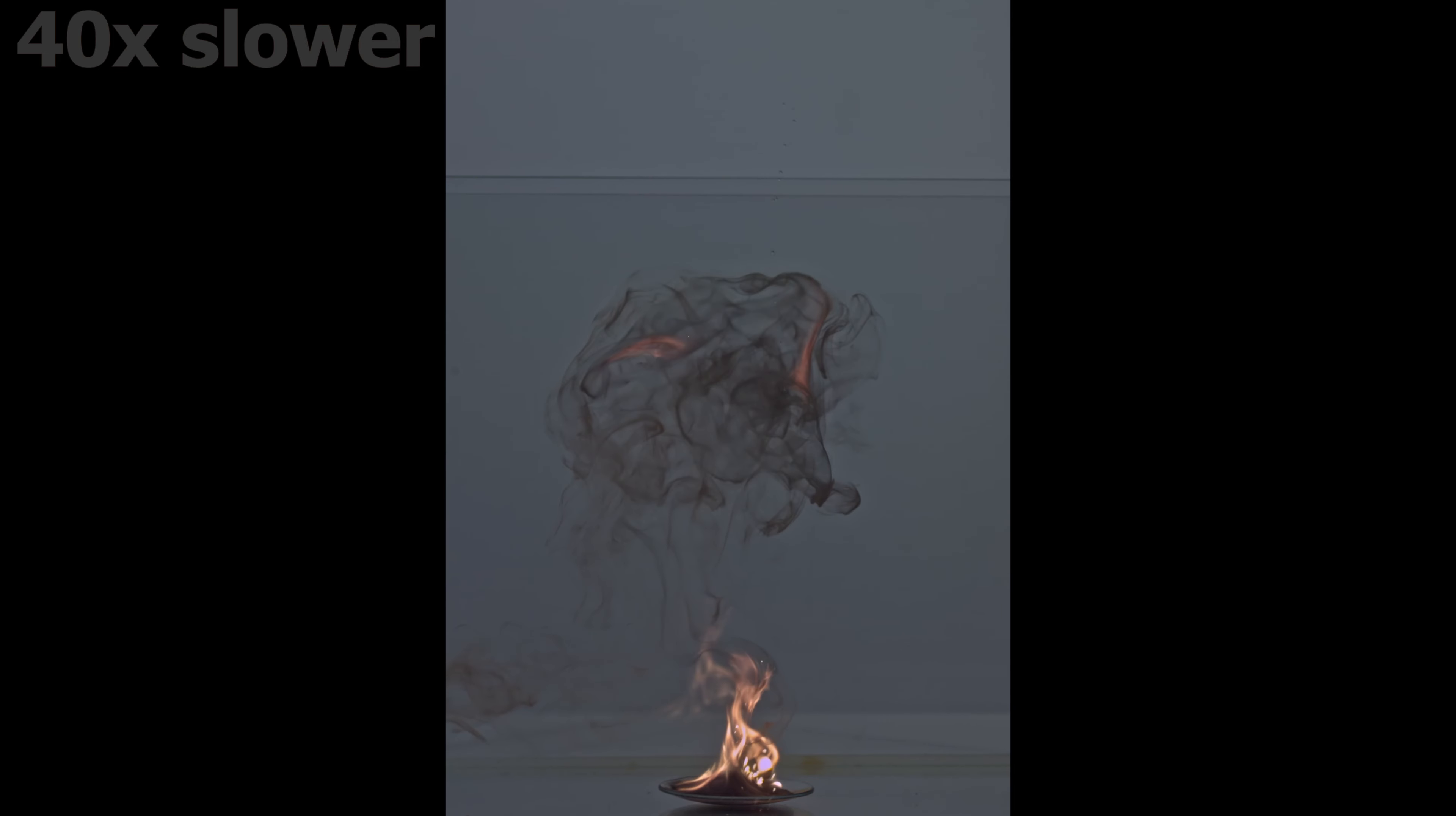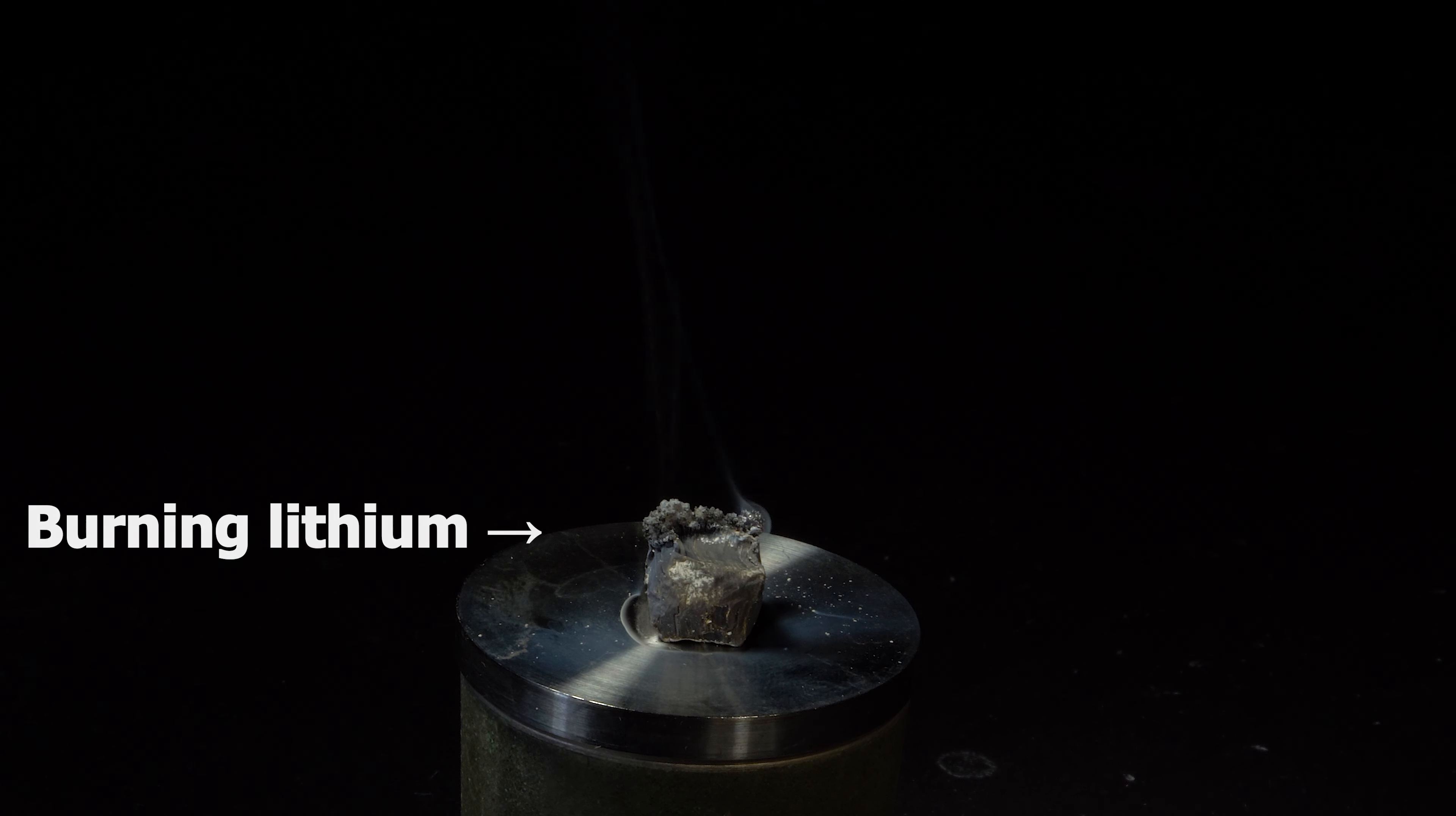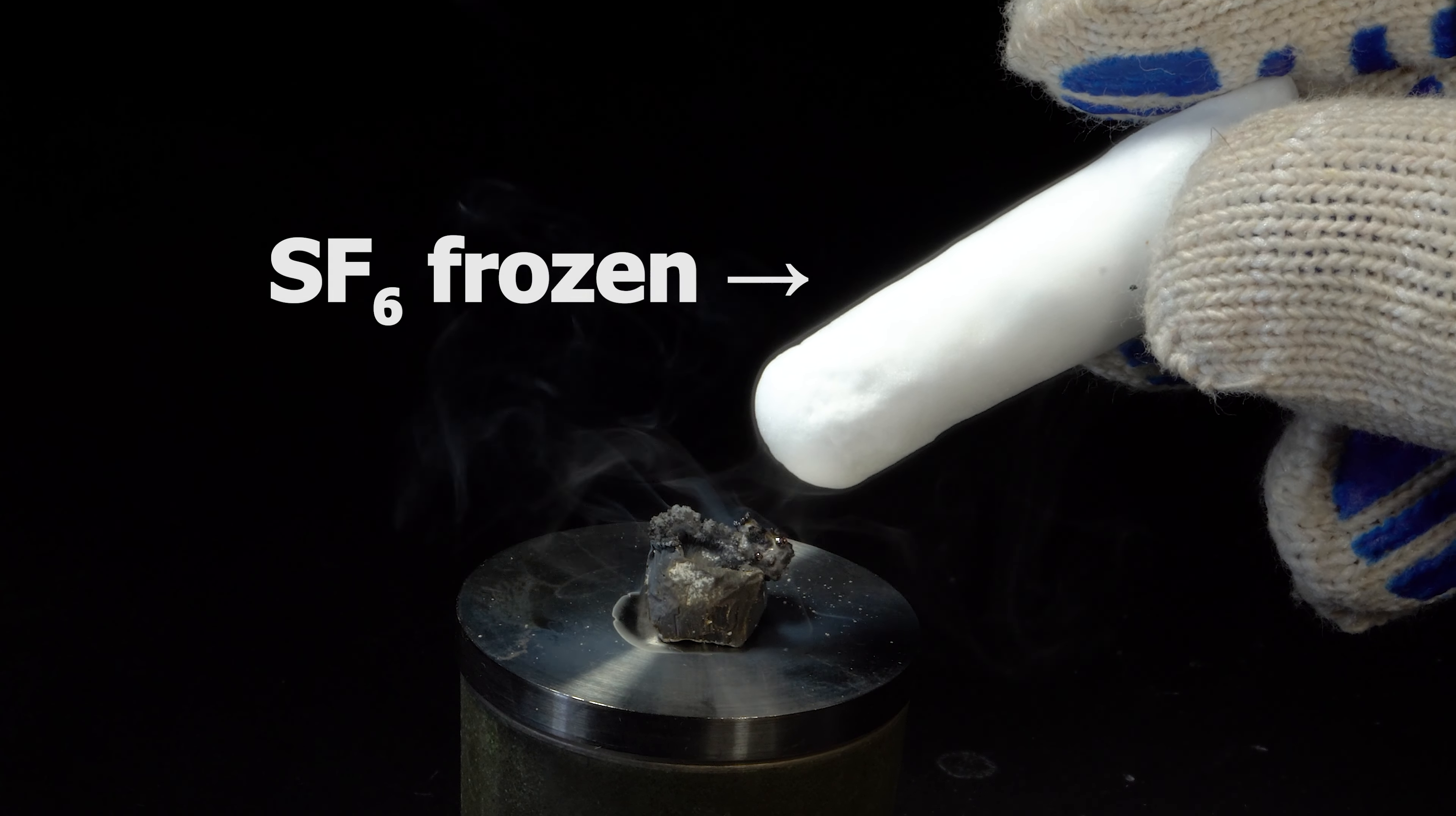Since this video is mainly about sulfur hexafluoride, I included its reaction with lithium here as well. The thing is, sulfur hexafluoride is quite a stable reagent. In order to make it engage in a reaction, we need a really high temperature, the fire point of metal, for example.